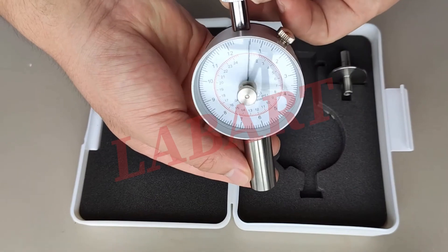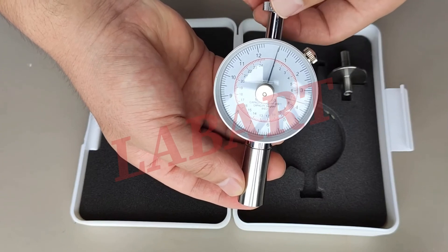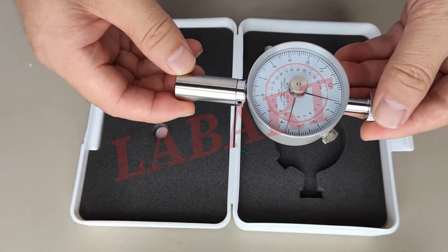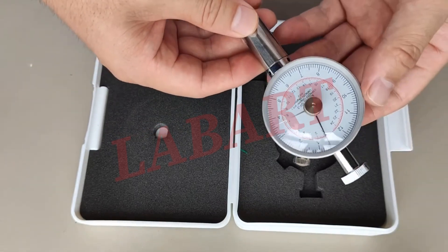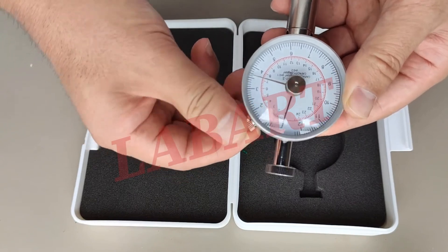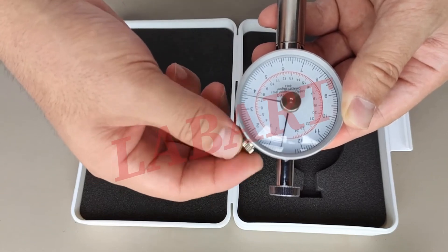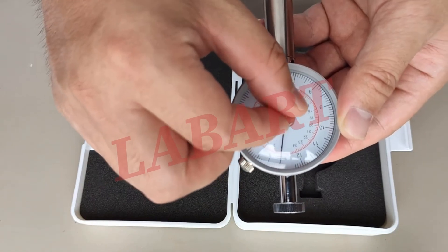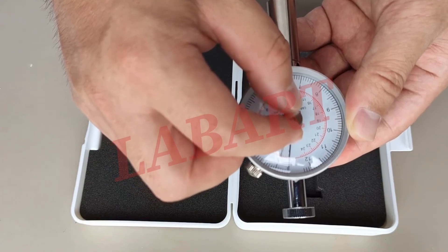You can see it. This is the dial and there are two needles. And here, these are the controls. We can use this button. This is to tighten it up. When we tighten it up, it cannot be moved. We can move this needle — this is the indicator needle.